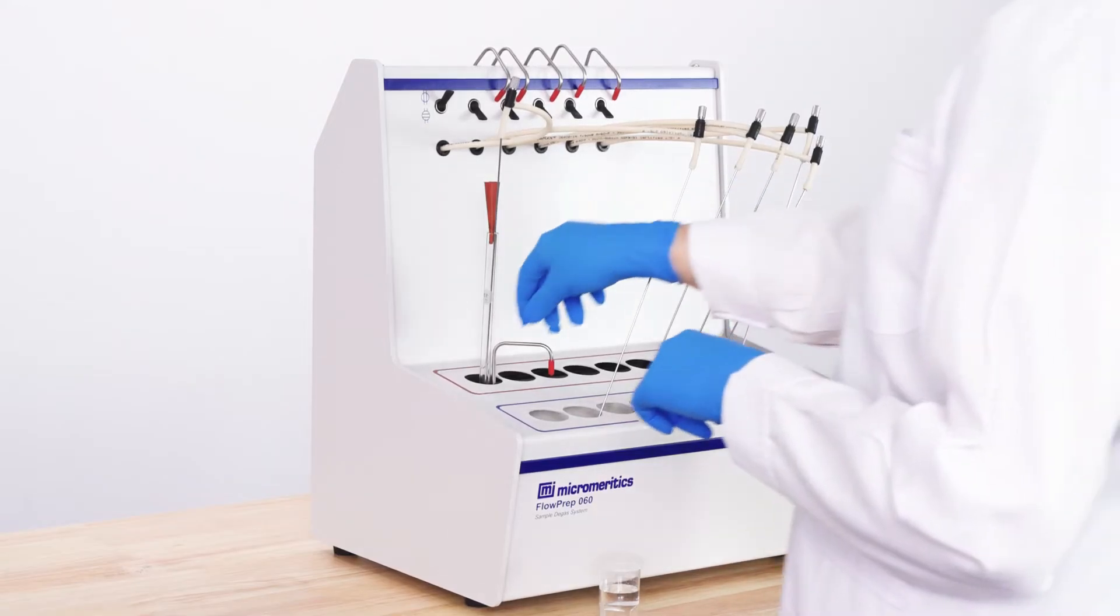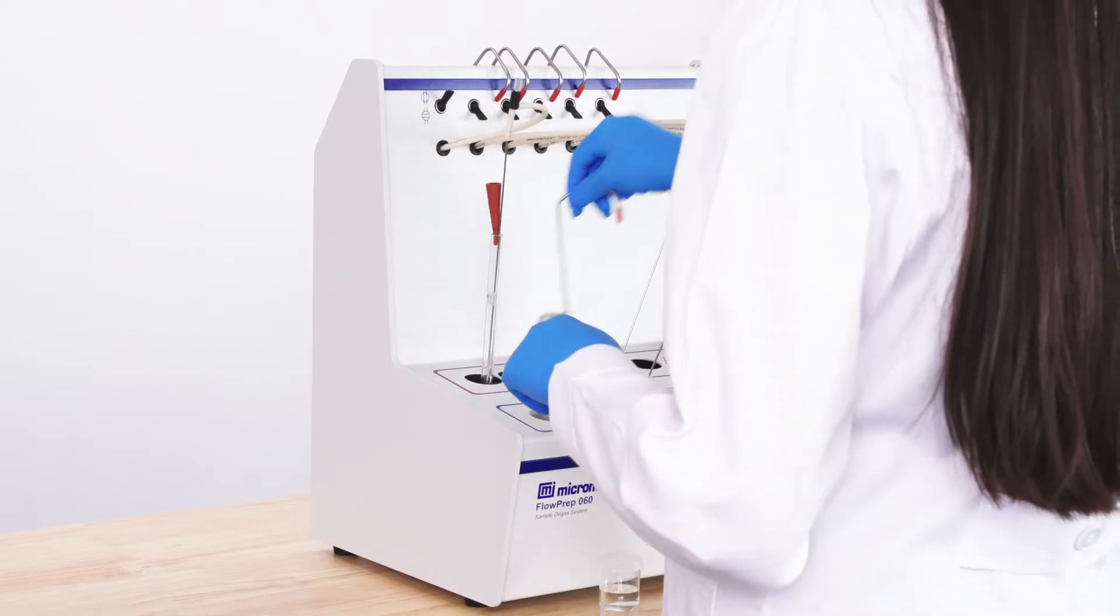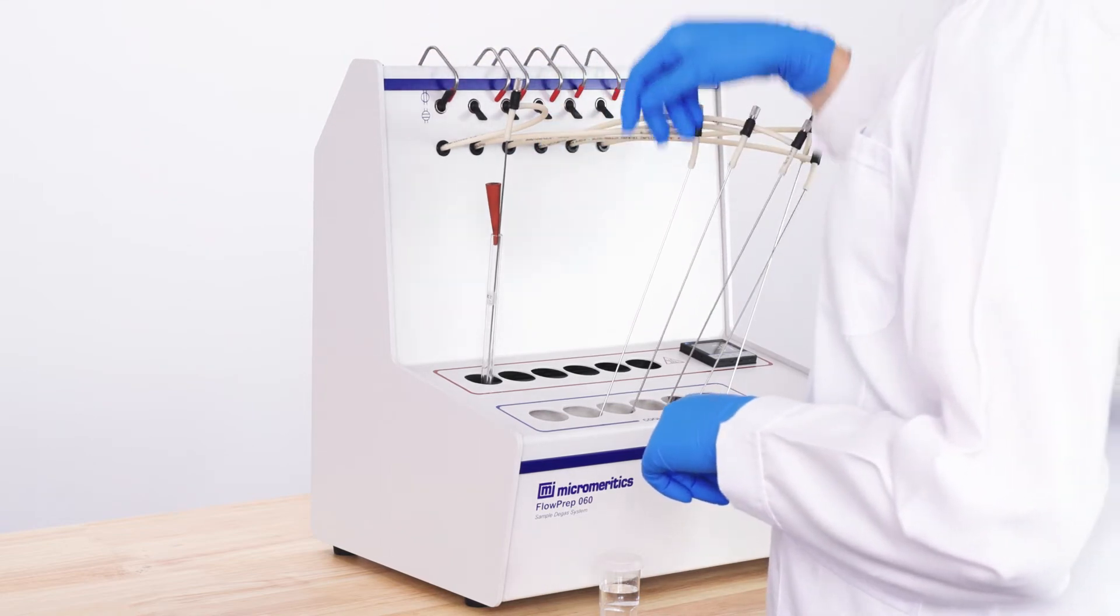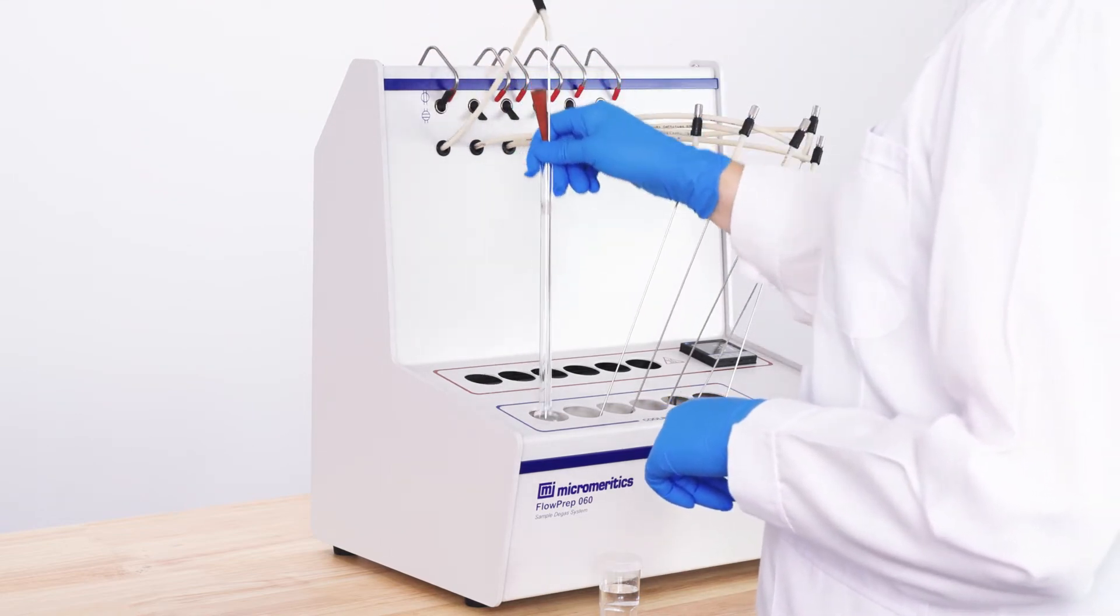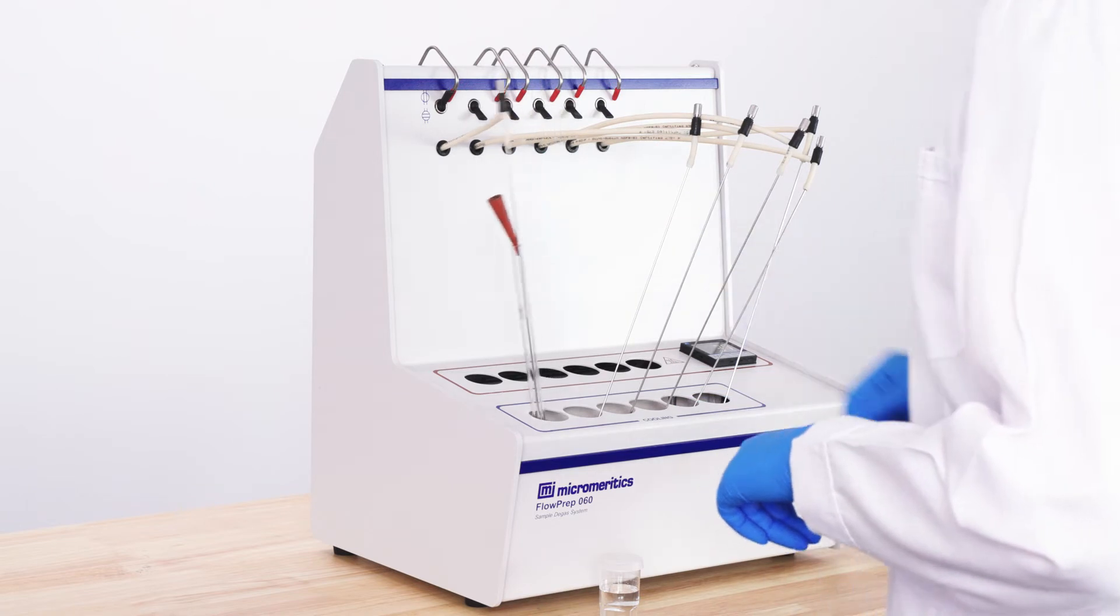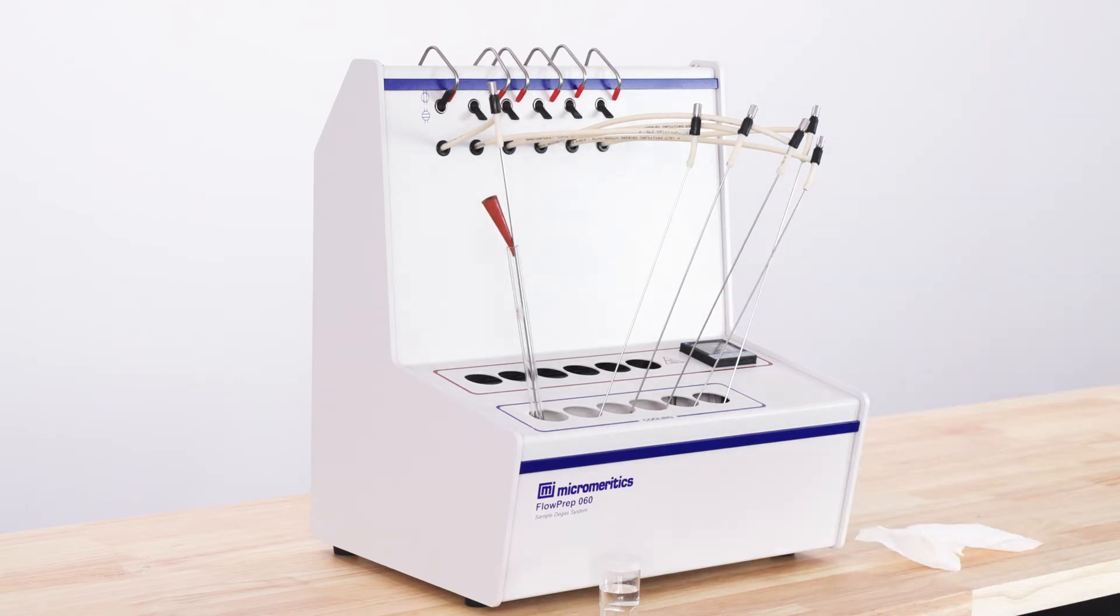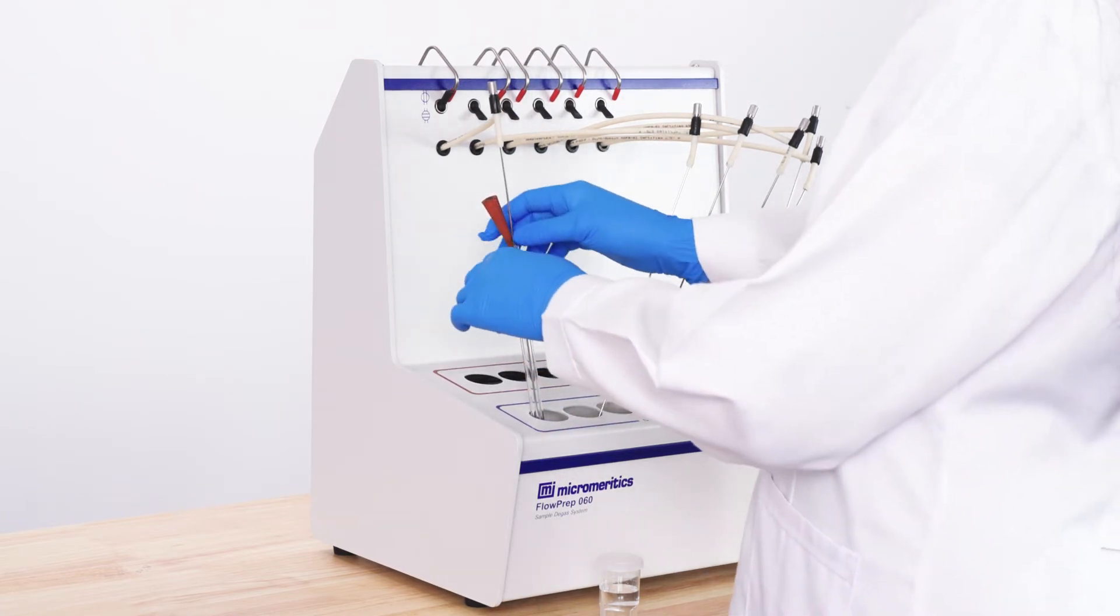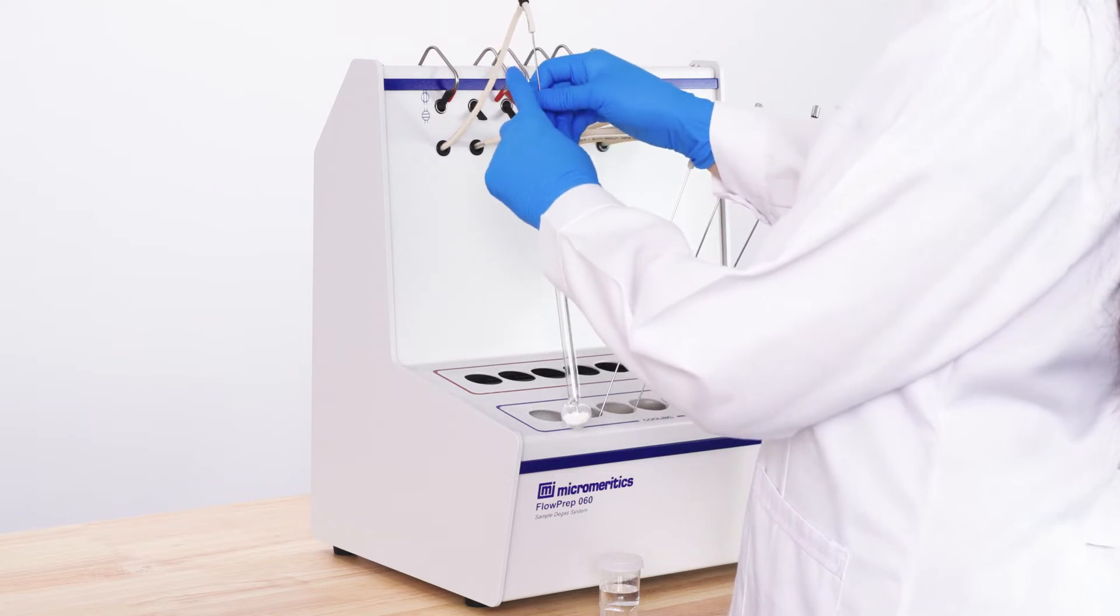Once degas time is complete, move the sample tube to the cooling station. Once the sample has cooled, it is ready to be weighed and mounted on your instrument.